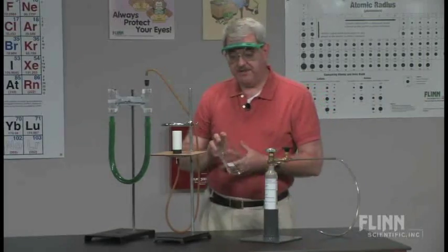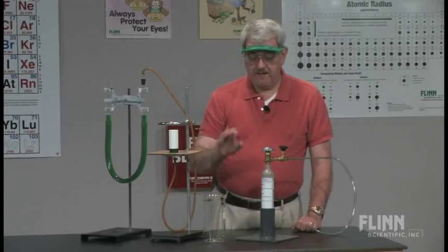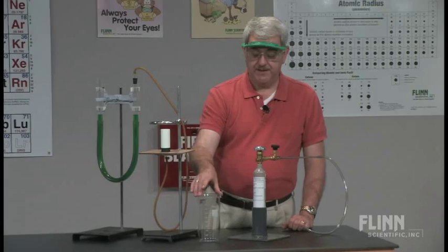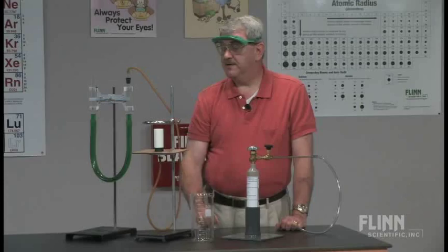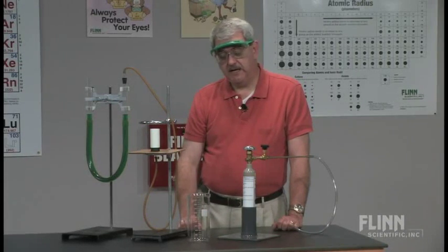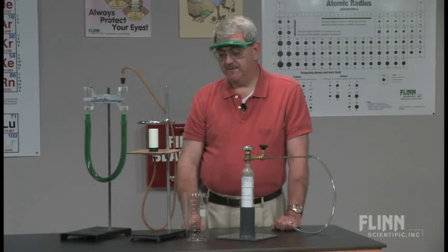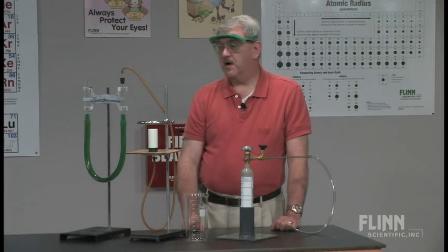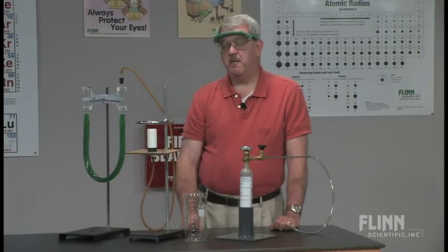You can do this demonstration with other gases as well, though it's not as clearly obvious. Heavier gases would have to be collected with a beaker like this. Other light gases will cause the same result, but not as visible to the students. It's a clear observation of Graham's Law of Effusion. It's a way of making an abstract concept a little bit more concrete in a way that is dramatic and memorable.